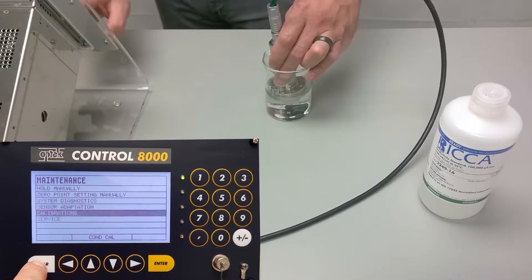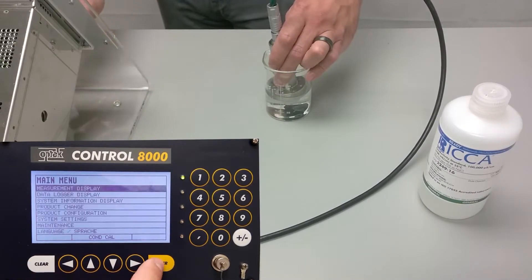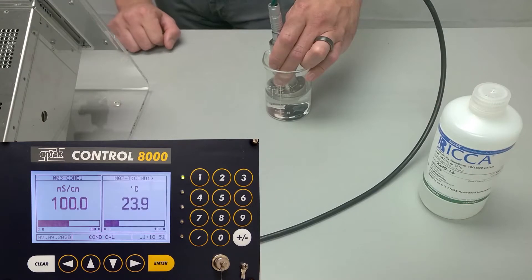Press clear to get back to the main menu and check the measurement display to perform a verification. With that complete, the calibration is finished.